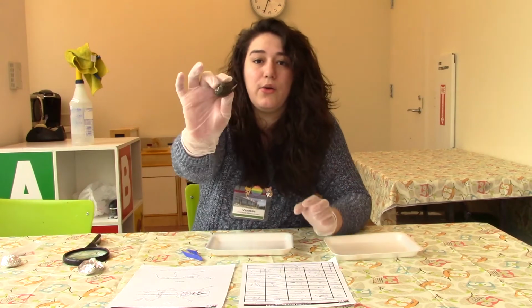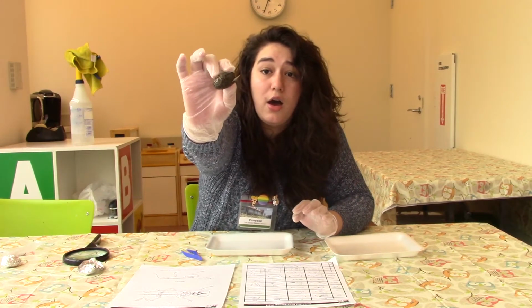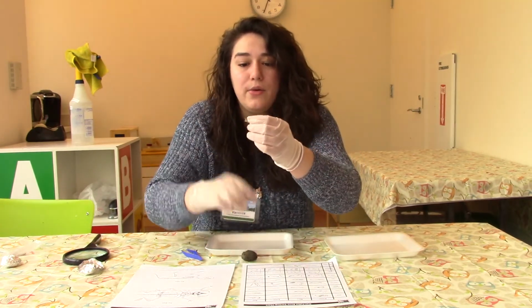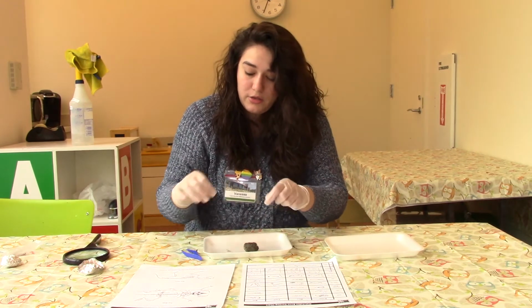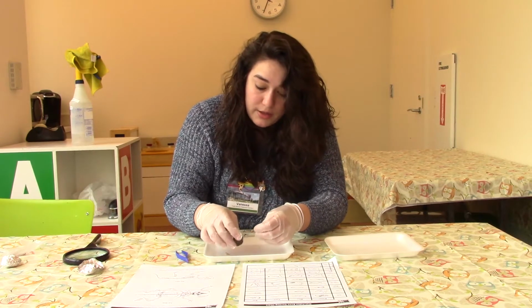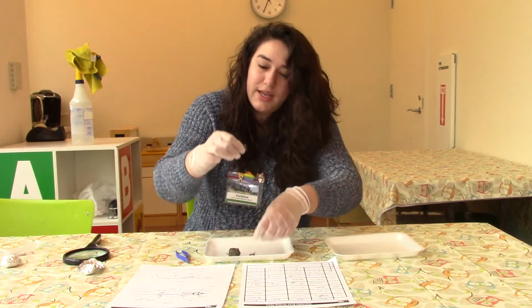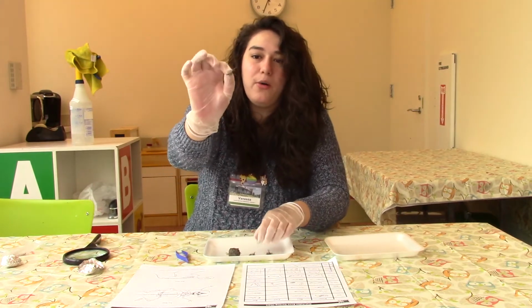Okay, so this is what it looks like, and it looks like we've already got a bone coming out of our owl pellet. So you can see that there's already something there. So I'm going to use my hands and my tweezers to pull this apart and see what we have in here, and then we're going to see if we can identify any of this. It looks like I can already see some fur inside of our owl pellet.